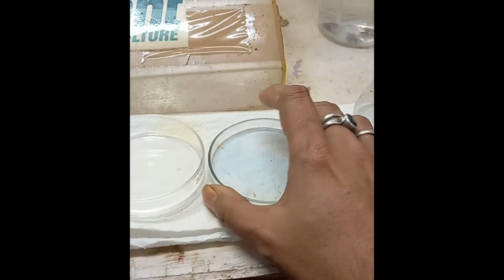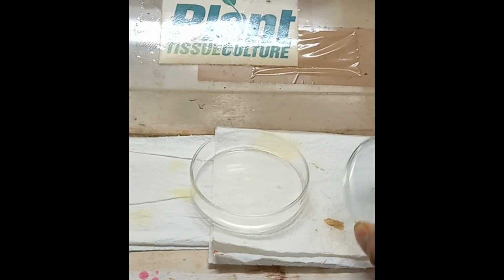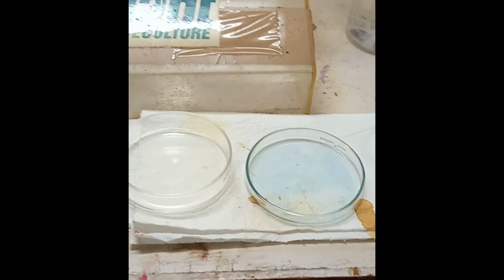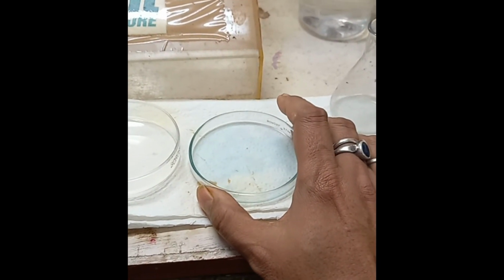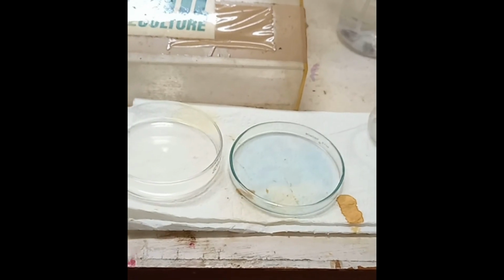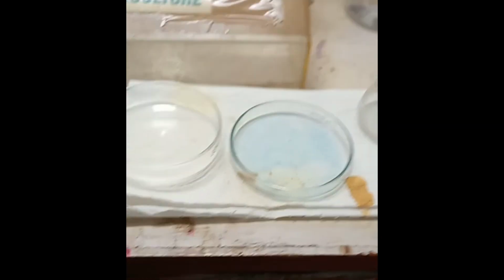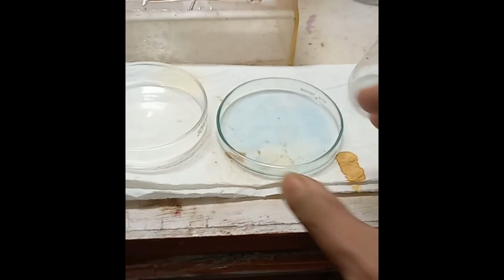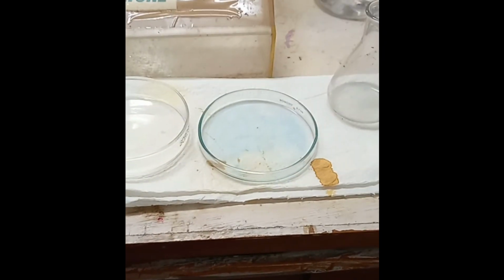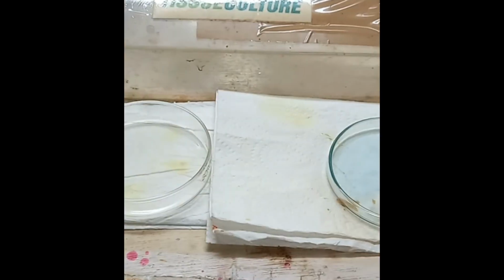Petri dishes are mainly used for keeping culture media, or for viewing under the TCM 400 inverted microscope, for direct investigation of the samples. Just taking some culture media from the flasks, you can place a drop in the petri dish and see it under the TCM 400 microscope. For direct investigation, these petri dishes are used.